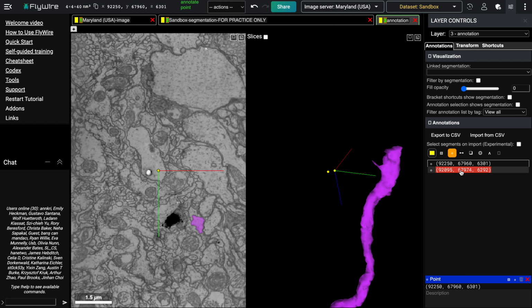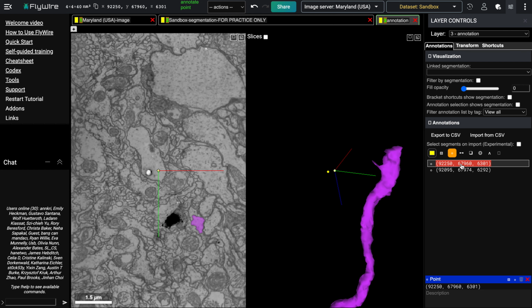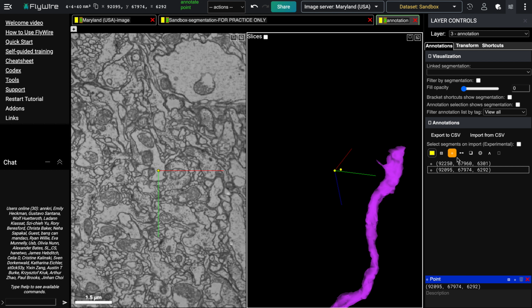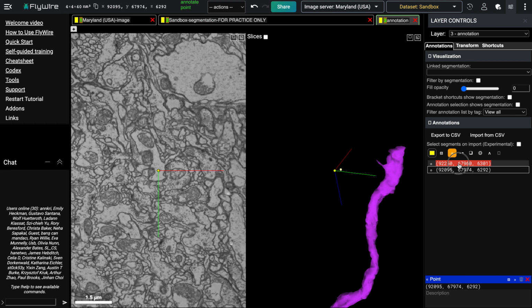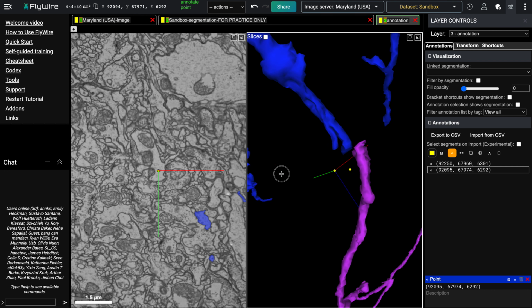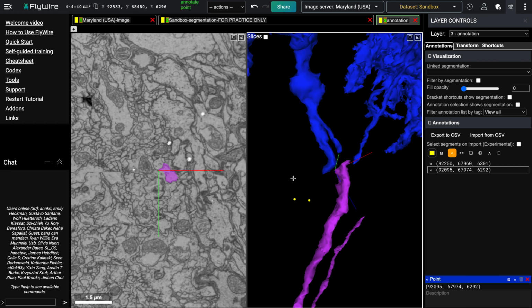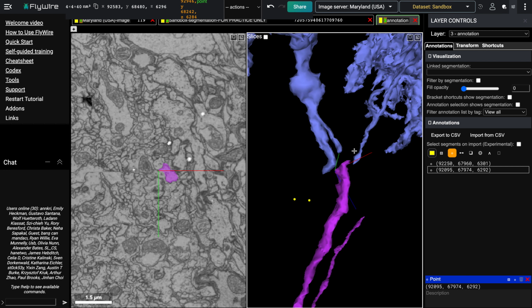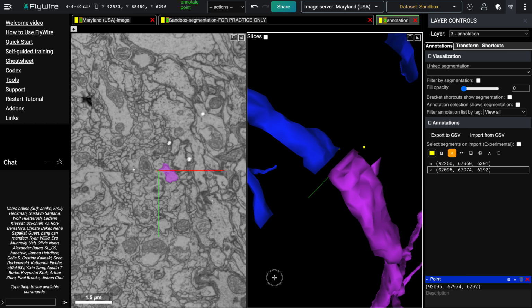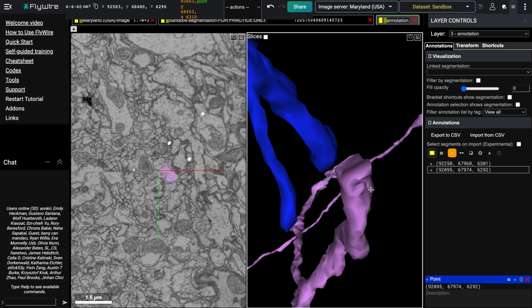As we click between these points, to me it looks like the continuation of the object is this right here. Click between them one more time, and I'm going to double click here, and then look over in the 3D. Obviously you can see in the 3D that there's a misalignment between these two objects, but what you want to be looking for is similarities between the structures, and I think that this structure and this one look pretty similar.